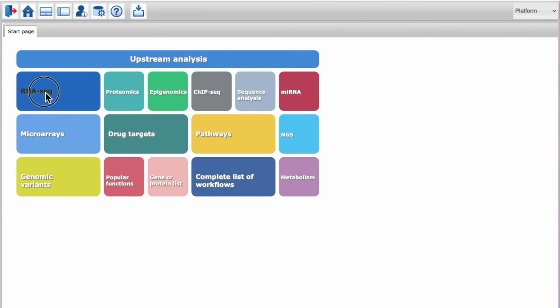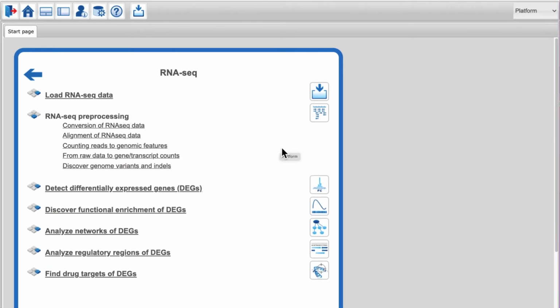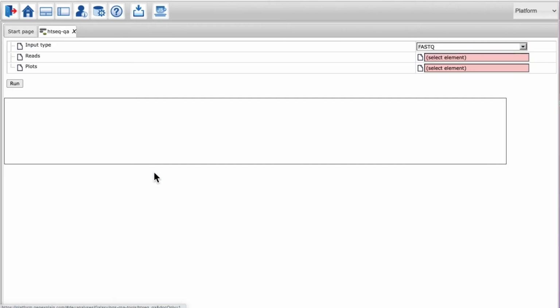First, select RNA-seq on the start page of the platform. Click RNA-seq preprocessing, then alignment of RNA-seq data, and finally, alignment quality assessment. The quality assessment tool opened. This tool works with raw FASTQ files or aligned reads in SAM or BAM formats. Let's select FASTQ format. Now the input file should be provided.